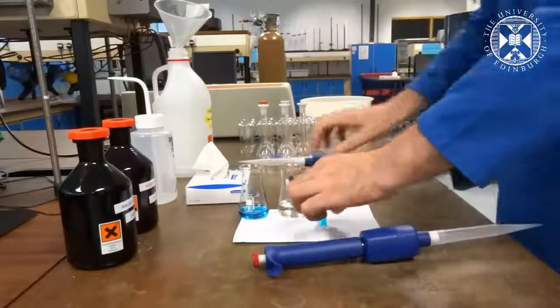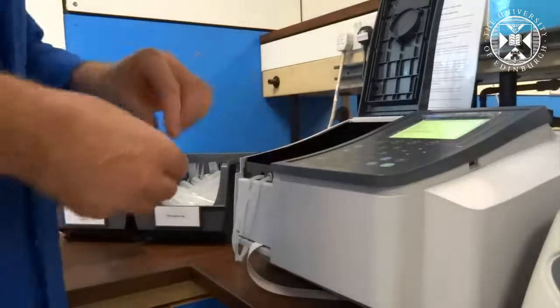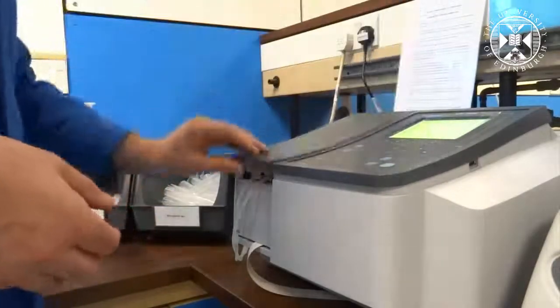Place the cap on and place into the spectrometer. The sample cell is the one closest to you. Once you close the lid you can quickly begin your kinetic scan.